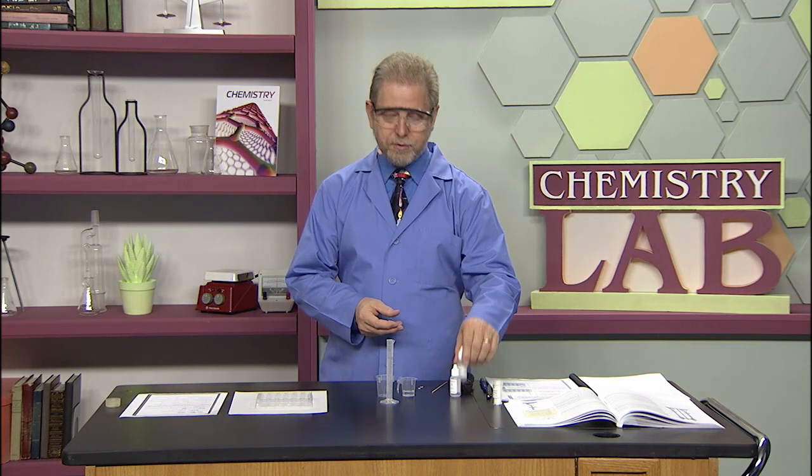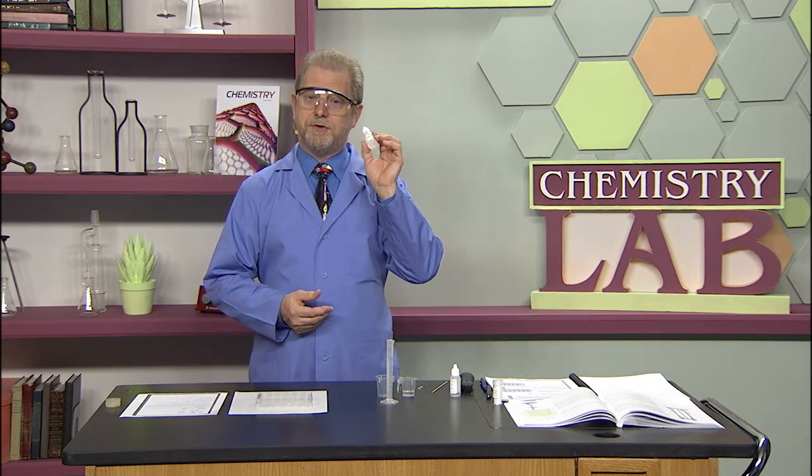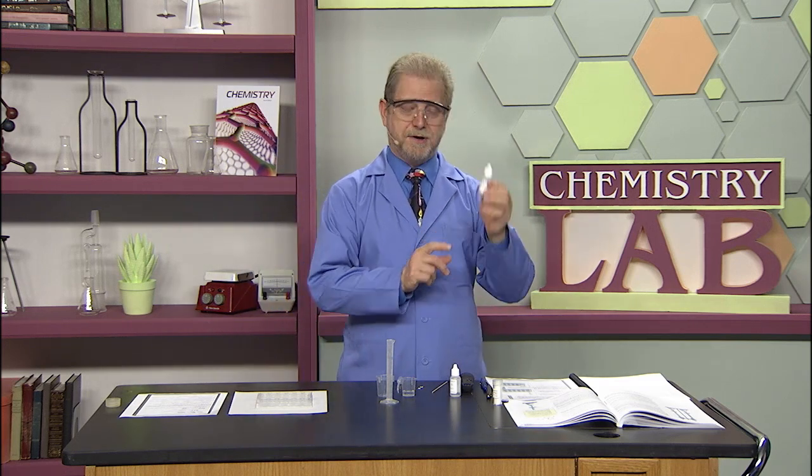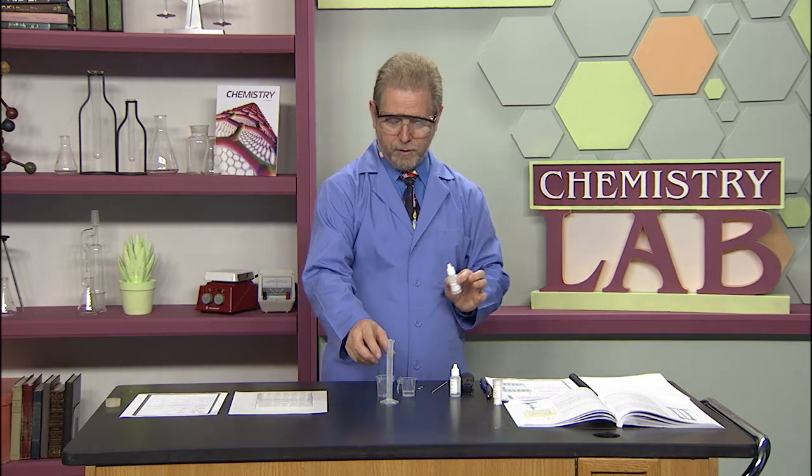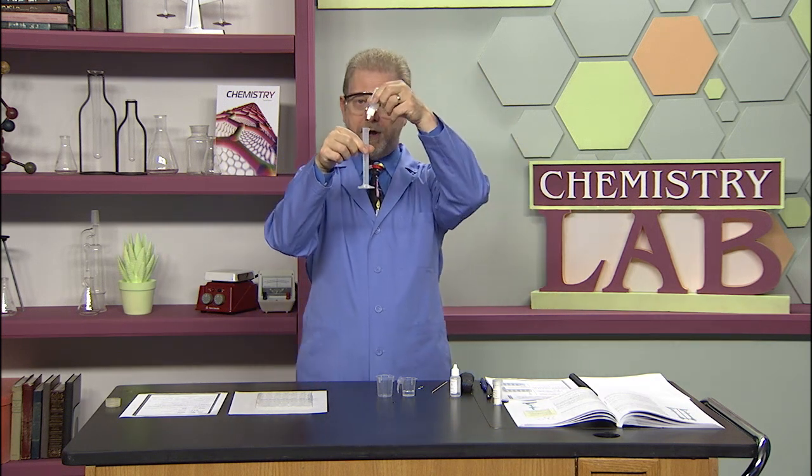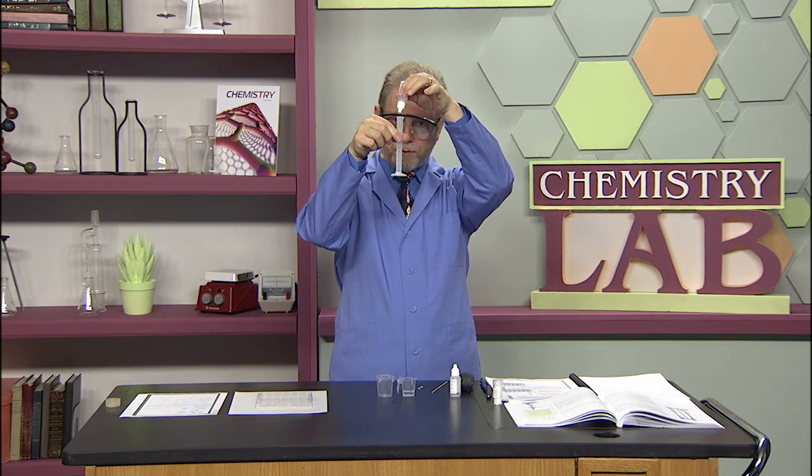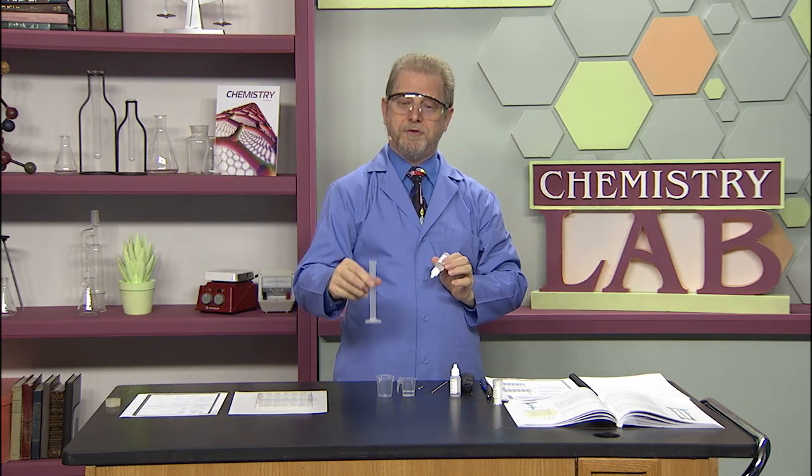The first thing you have to do is calibrate your dropper. Get your distilled water dropper, 10 milliliter graduated cylinder, and count the number of drops in 1 milliliter. Drop, drop, drop, drop, drop, drop, and I came out with 20.